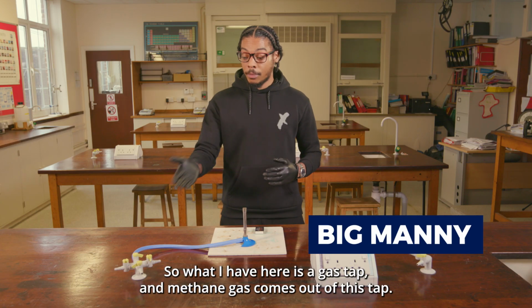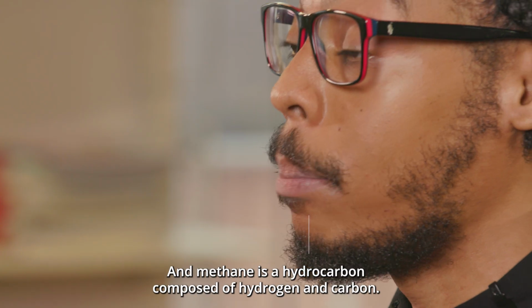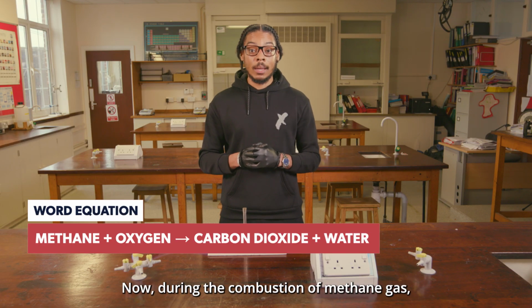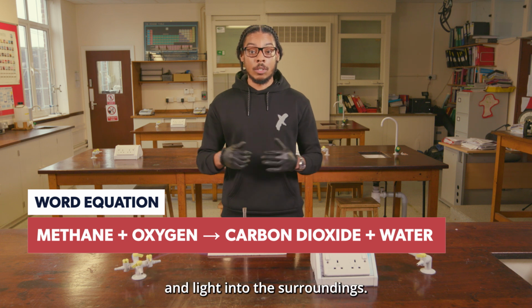Alright, cool. So what I have here is a gas tap, and methane gas comes out of this tap. And methane is a hydrocarbon composed of hydrogen and carbon. Now, combustion of methane is also known as burning. During the combustion of methane gas, the fuel reacts with the oxygen in the air and it transfers heat and light into the surroundings.